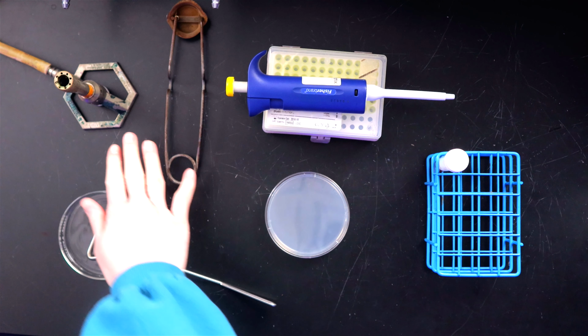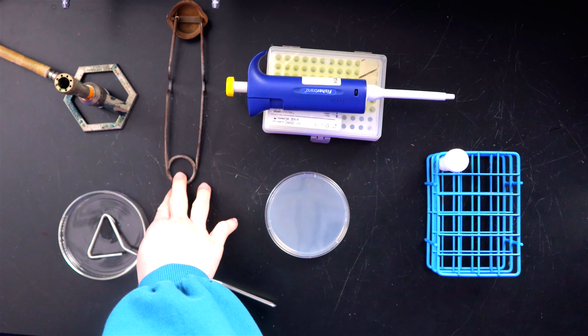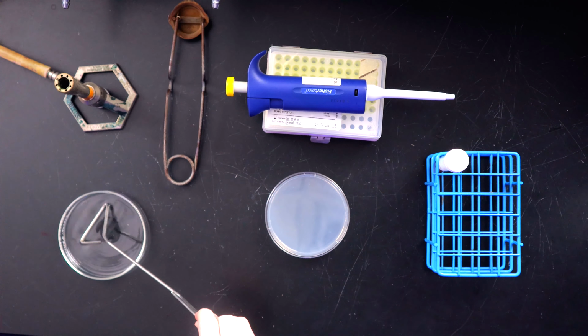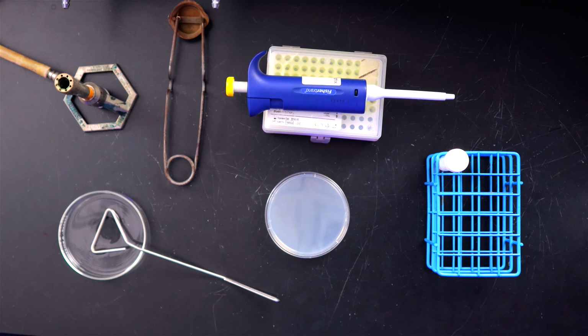All right. And then, of course, we have our Bunsen burner for sterilization and our striker for when we need to light the Bunsen burner. Okay, and what's this liquid that the spreader's in? This is alcohol. So we just place our spreader in the alcohol and we leave it there so that it can sterilize when we're not using it. Okay, so the alcohol is sterilizing the spreader. Awesome. Well, can you show us how the student would do this inoculation?